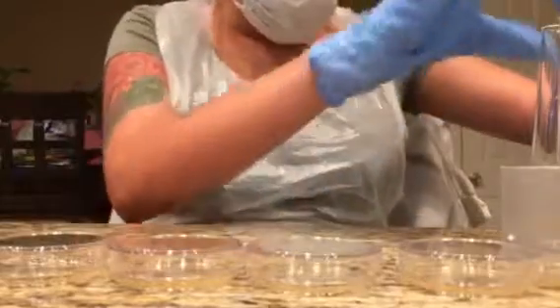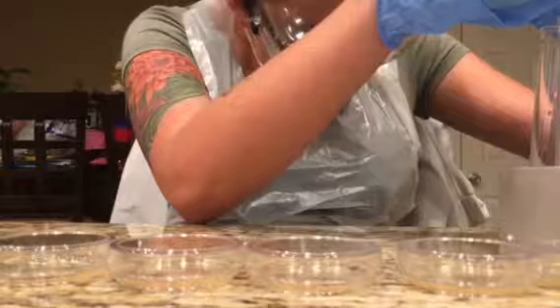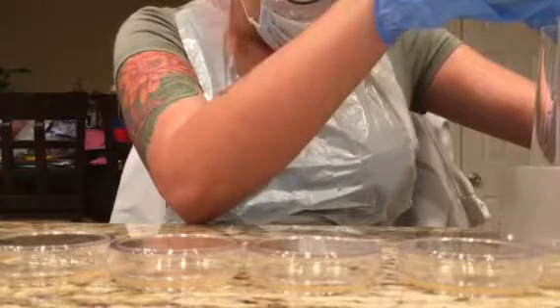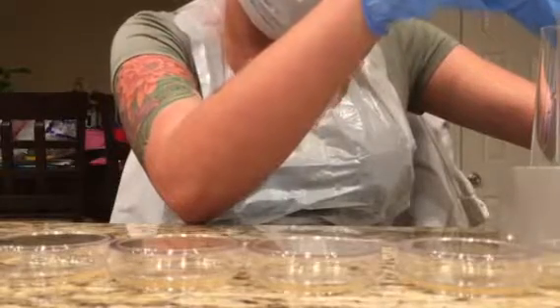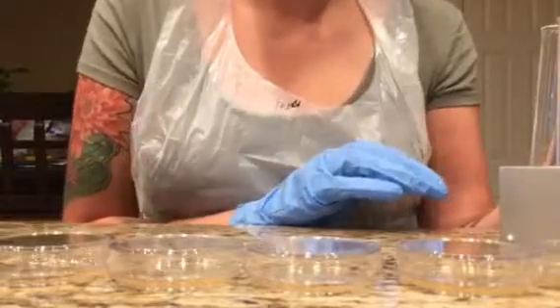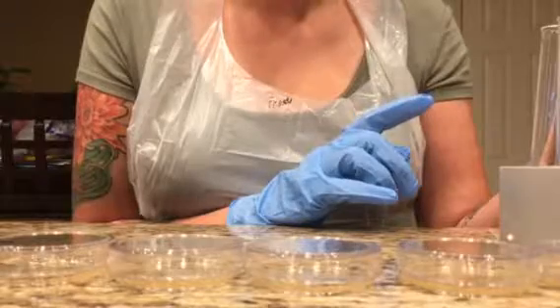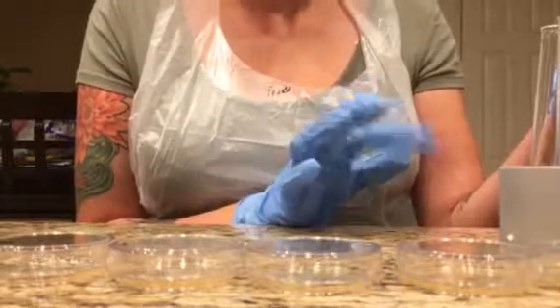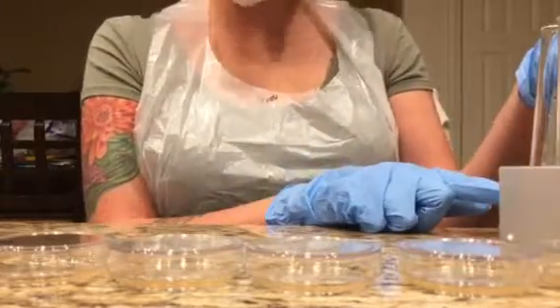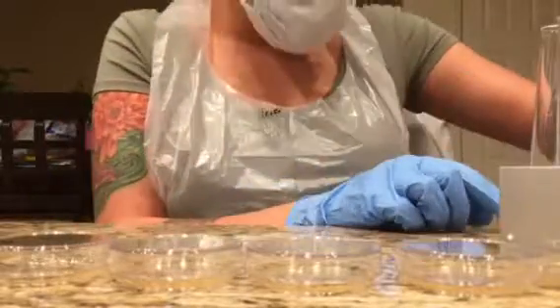So I have a hard time with these because they seem to fall over the place. They're not set correctly within the rack. Okay, so test tube 1 is done. Next, I will get 0.25 milliliters of the first test tube and then transfer it over to the second test tube, and from there continue to do so all the way up to the 6th tube.